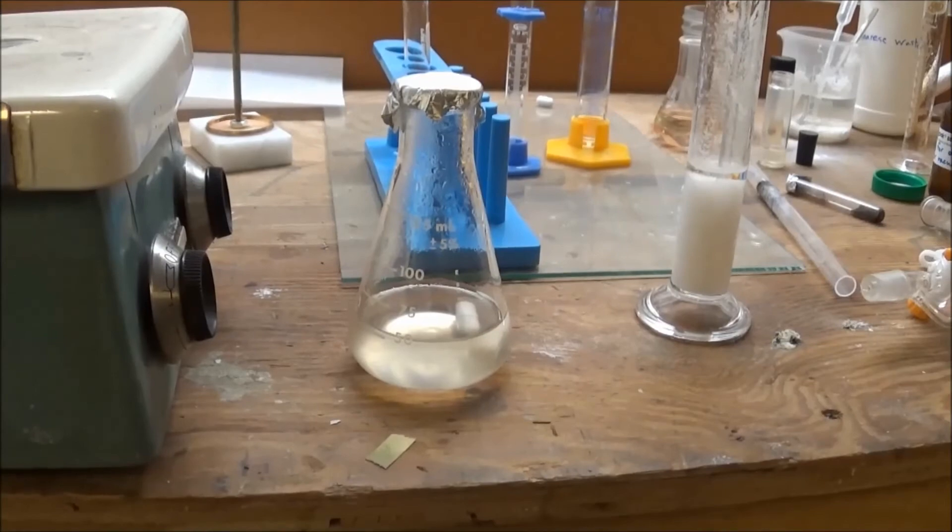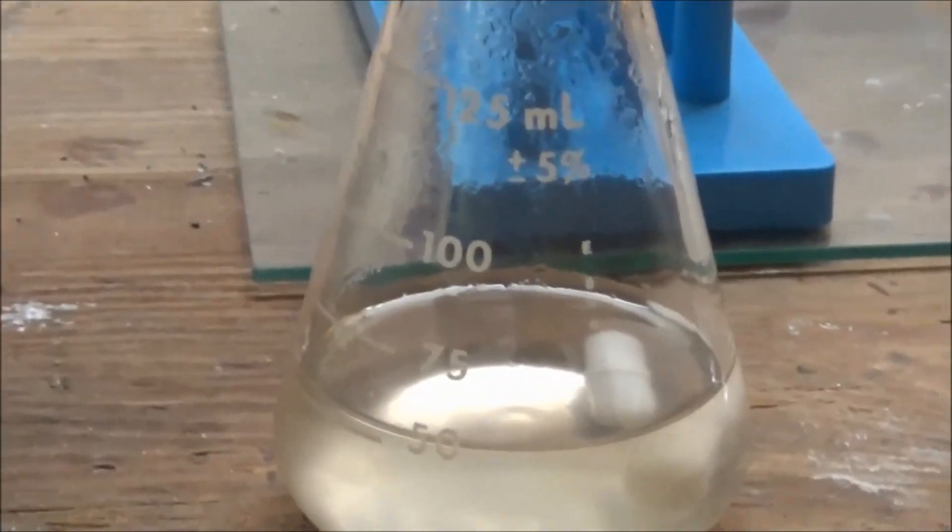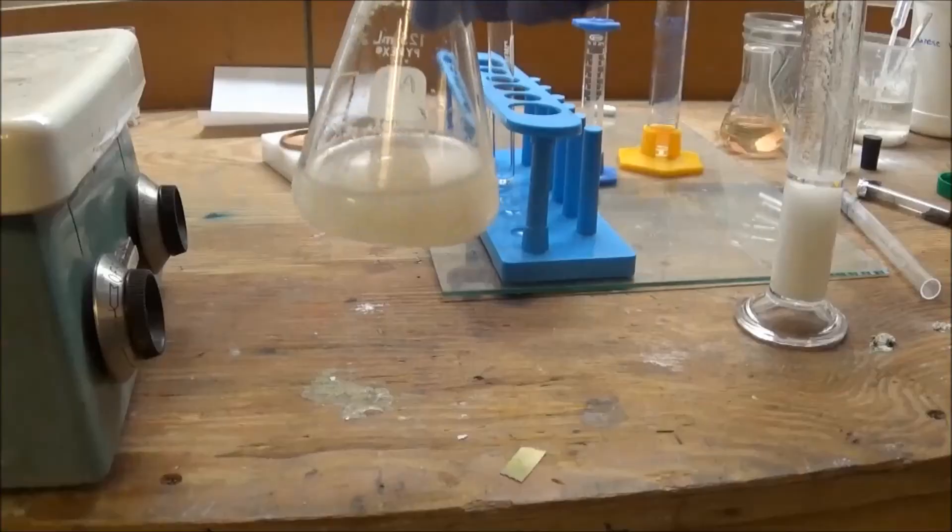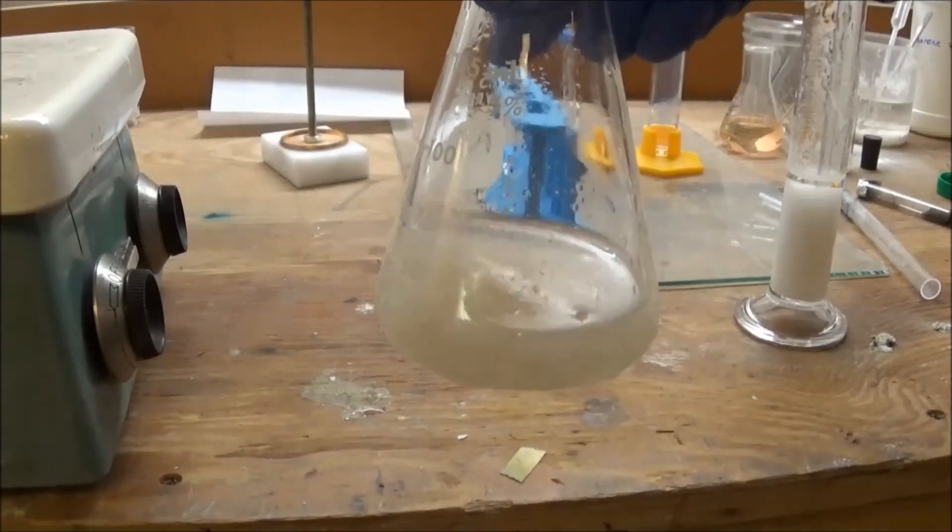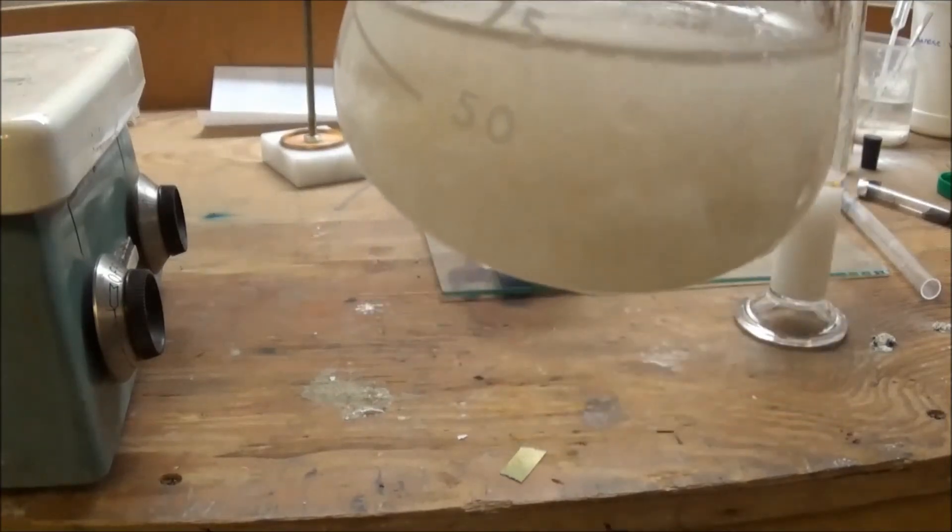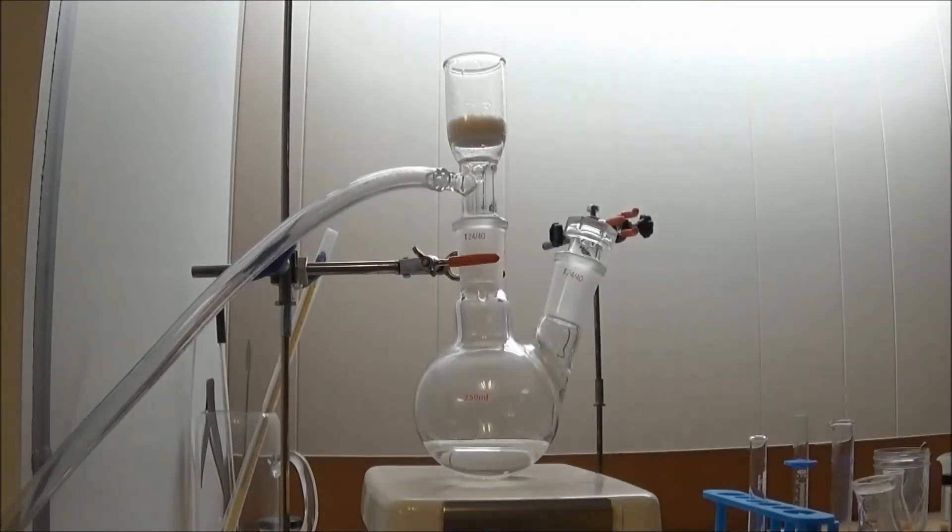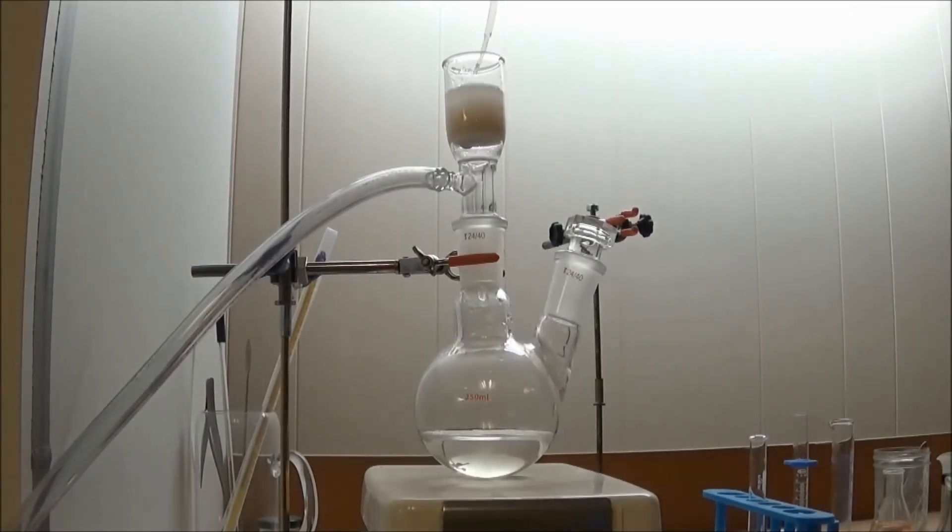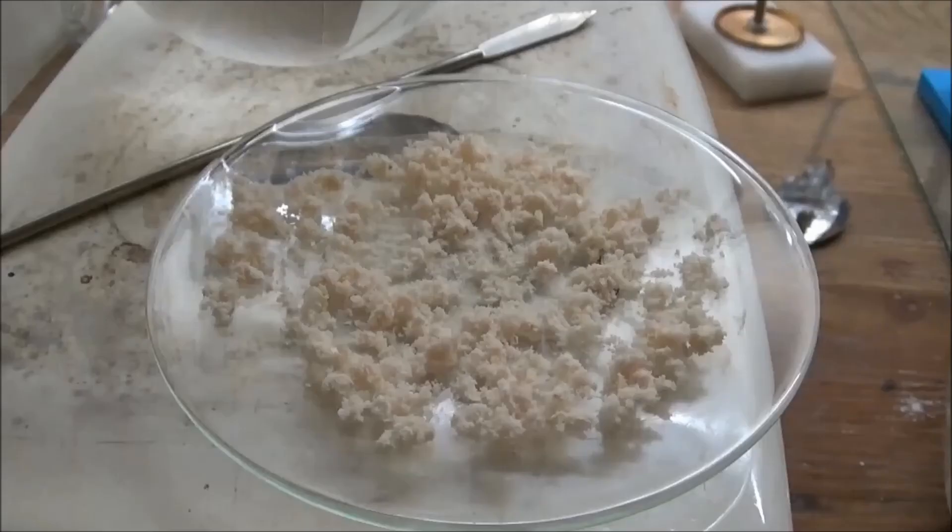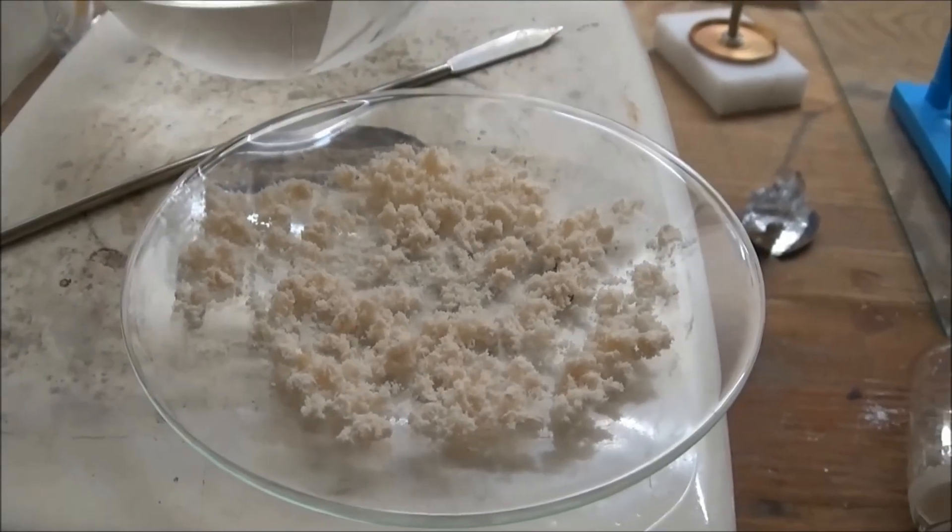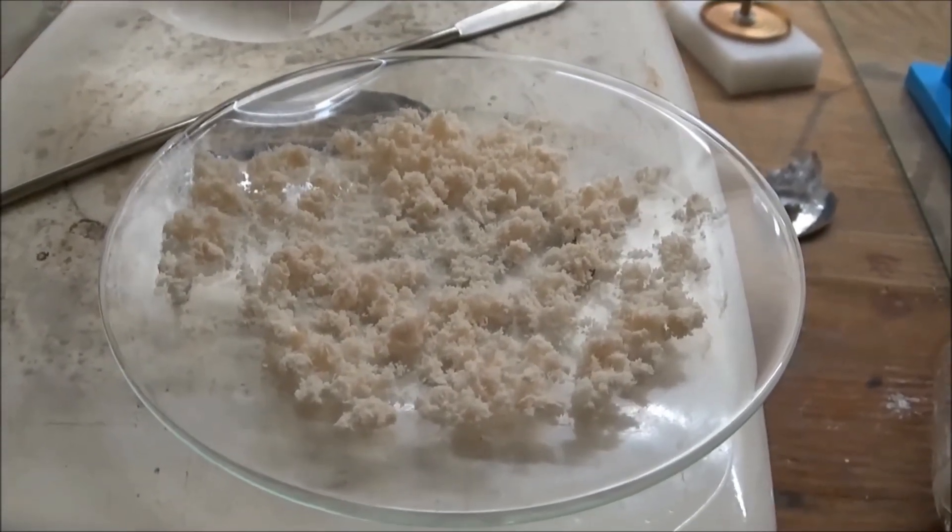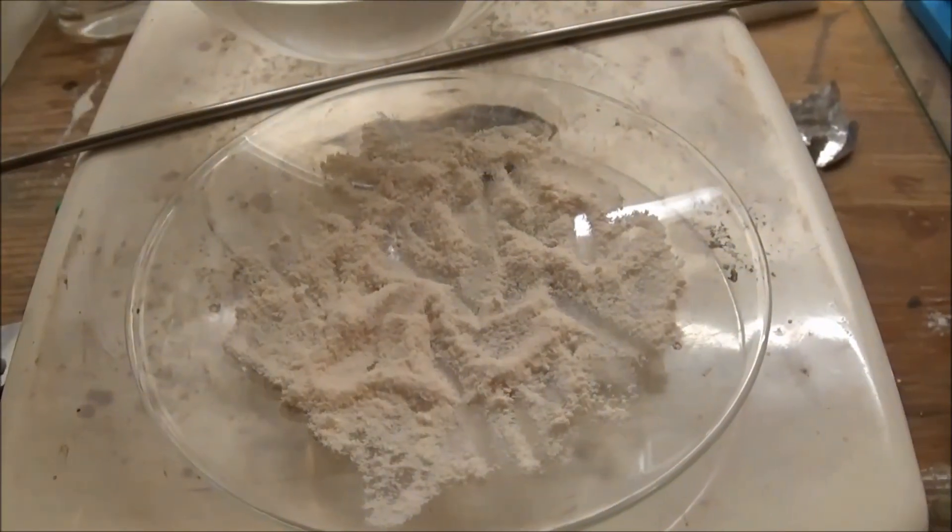When the bubbling stopped, I took the flask off and let it cool to room temperature. I was pleased to see that a bunch of crystals had formed, and I proceeded to filter them off with vacuum filtration. I was left with this damp powder, which I left overnight to dry.